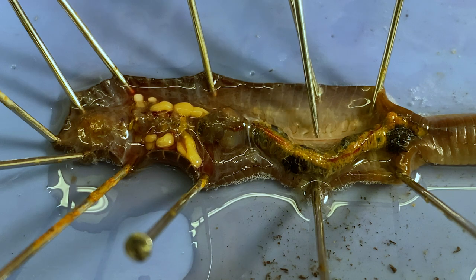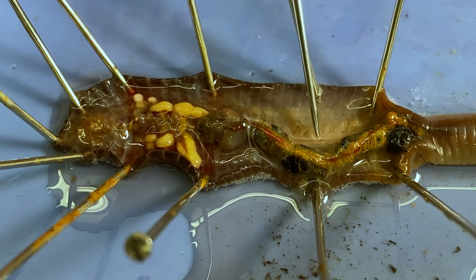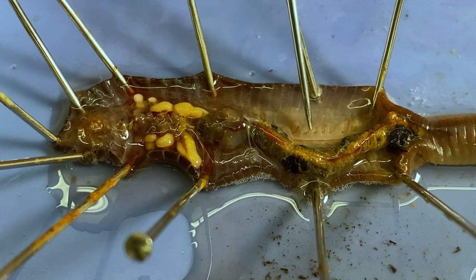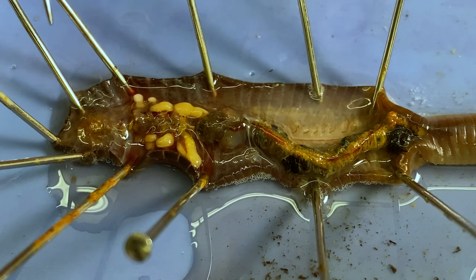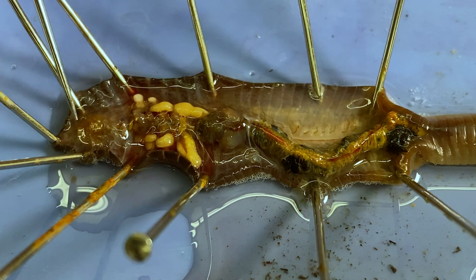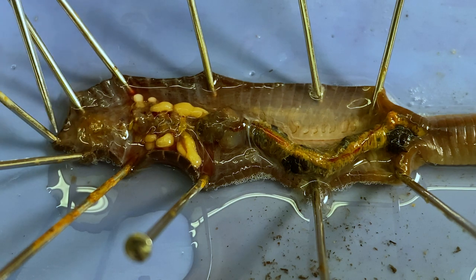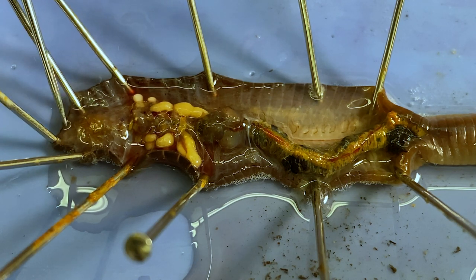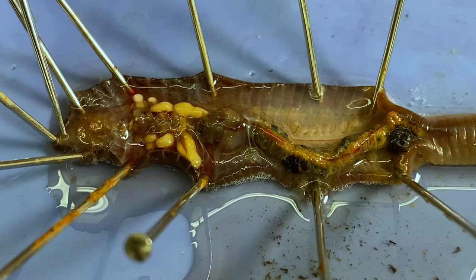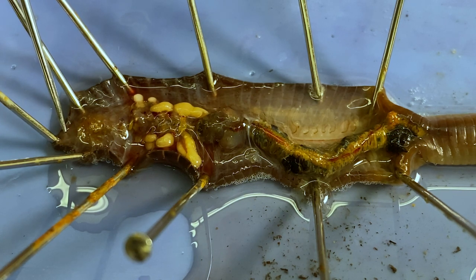Over here you can really nicely see the double ventral nerve cord — those whitish lines. There's actually a pair of nerve cords very close to each other, and you can see nerves branching off the ventral nerve cord. The nerve cord continues underneath the gut and gets to the anterior region where it encircles the buccal cavity. There are little thickenings there called ganglia — the cerebral ganglia — which we'll try to look at under the microscope.